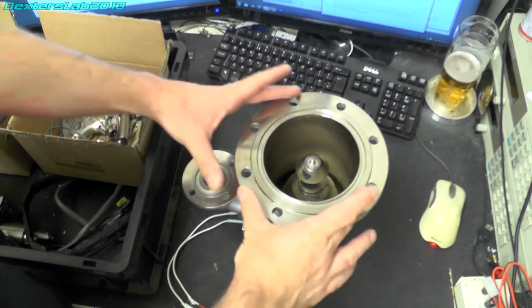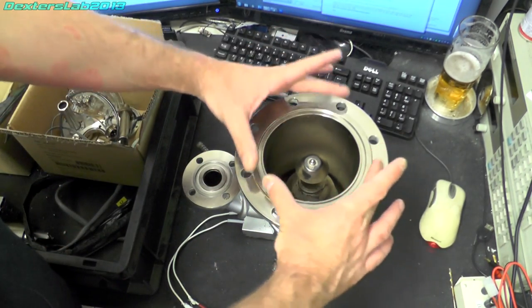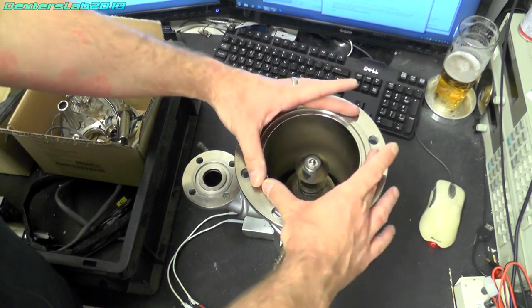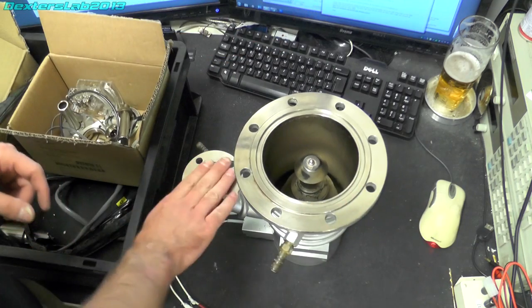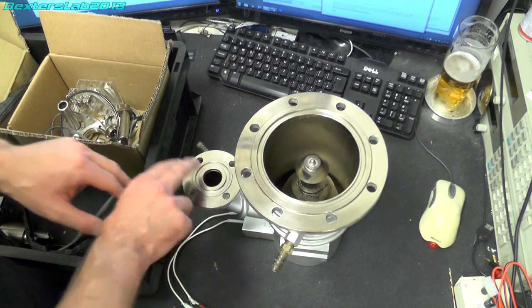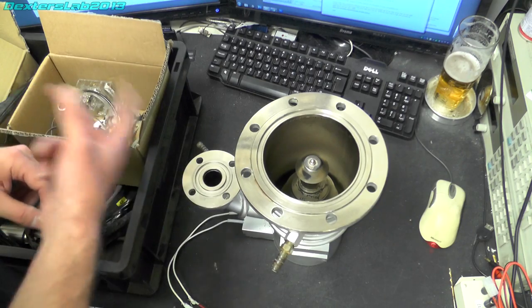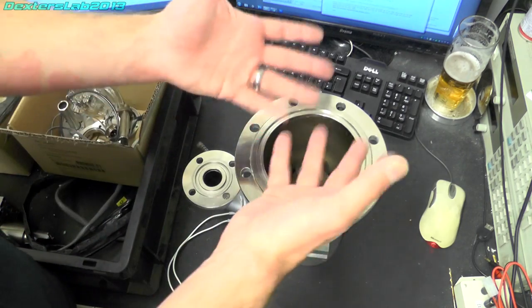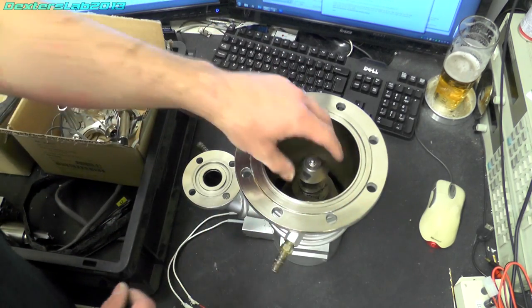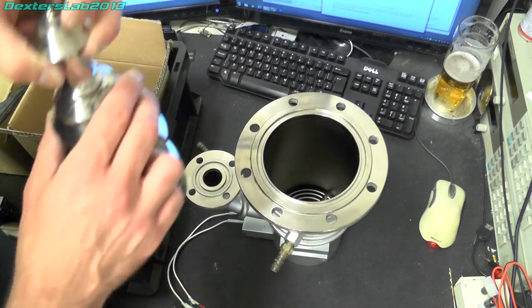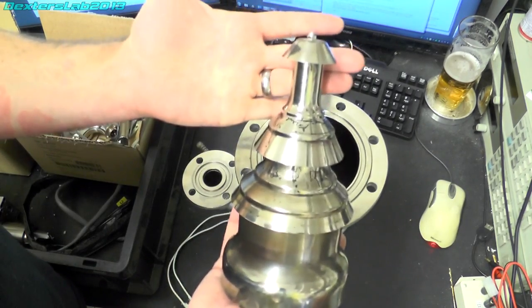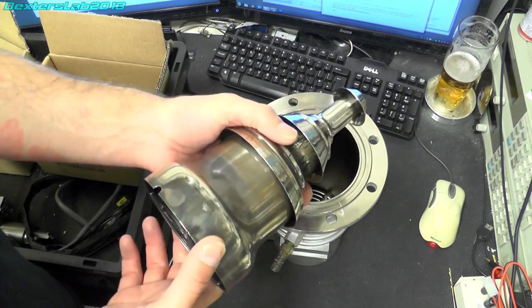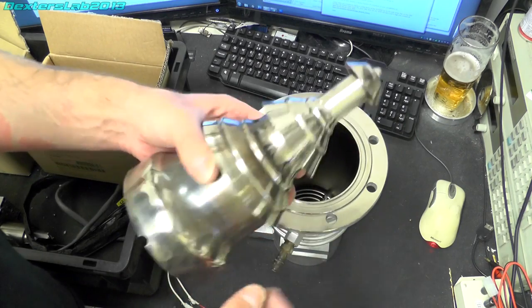So this is the main inlet to the actual pump. The outlet is here and that attaches then to a roughing pump and that's continually sucking out. And the way these systems work is really really simple. Inside here we have the Christmas tree which is a couple of baffles.